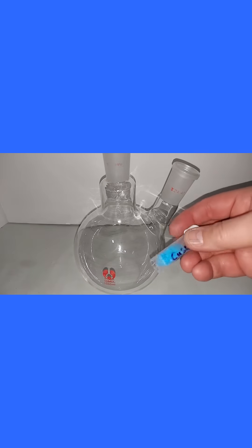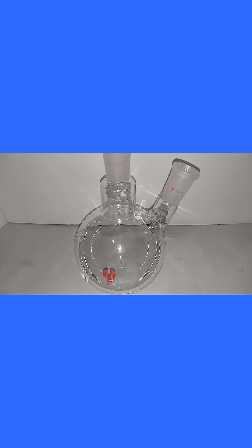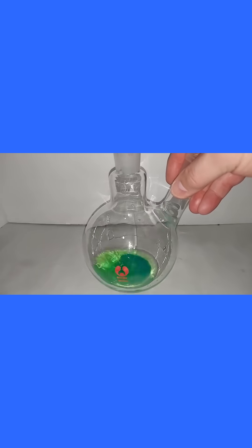I have the five grams here of copper sulfate pre-measured. I'll be adding it to this round bottom flask, and then the 40 milliliters of 15% hydrochloric acid, and I'm just going to swirl that around a little bit.